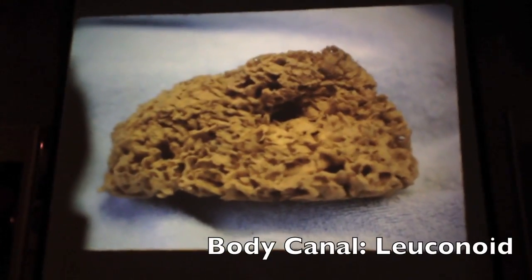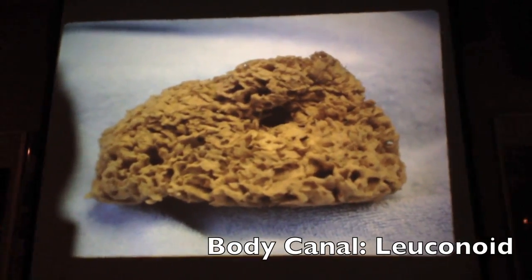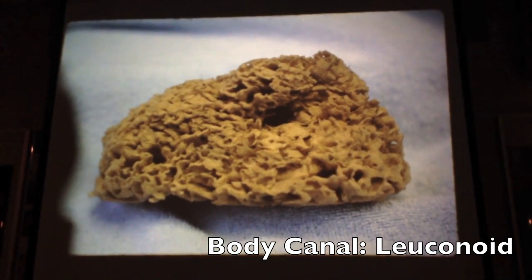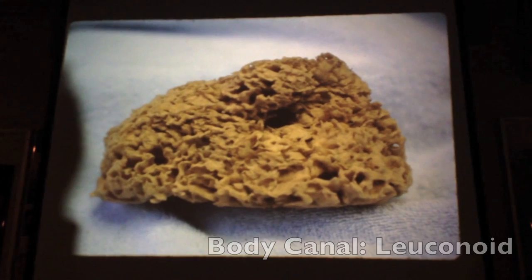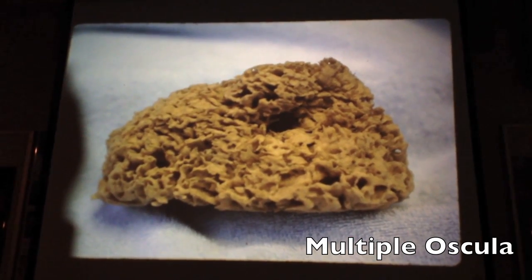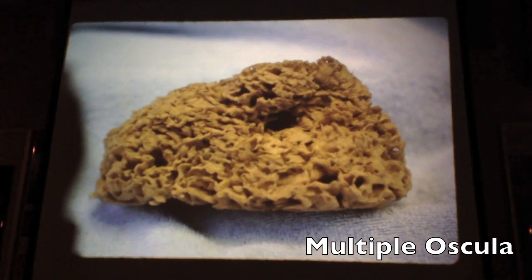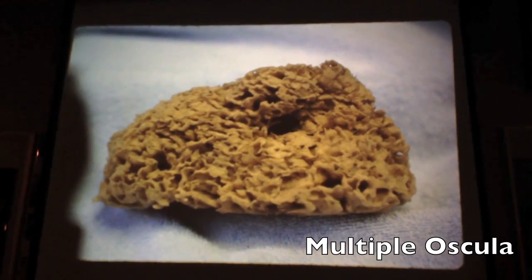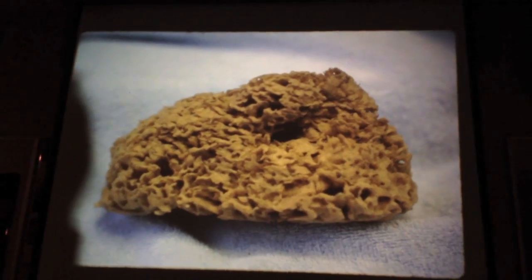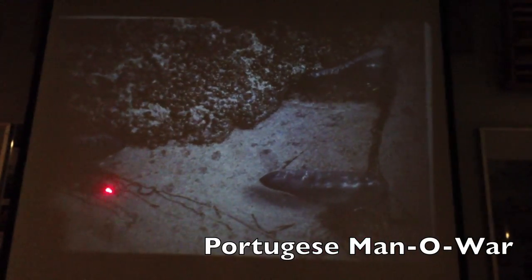Okay, and what body plan is this? Is this leucon, ascon, or sycon? So it's definitely leuconoid. Multiple oscula. No real shape to it. One you looked at, the longitudinal section of that would be a syconoid one, the tubular one. This thing right here, these little strands.